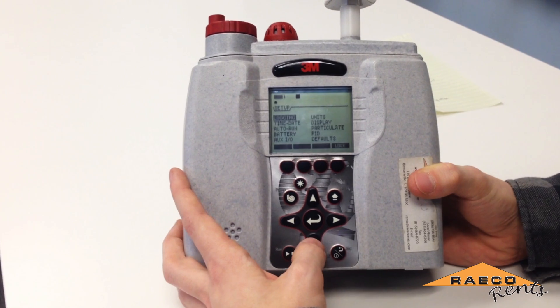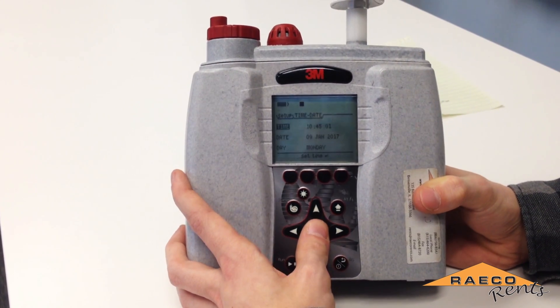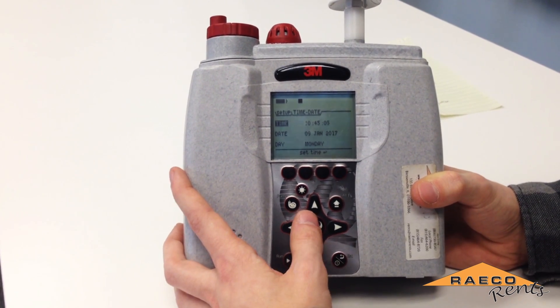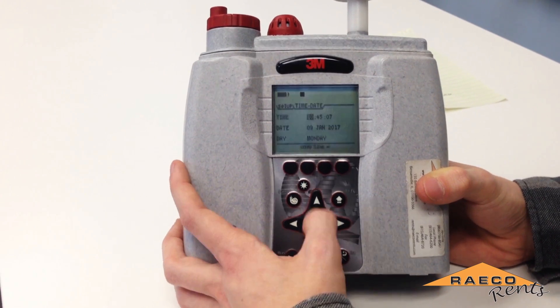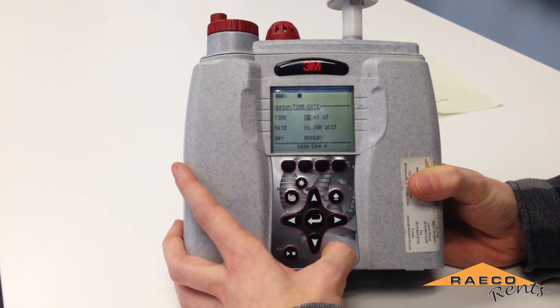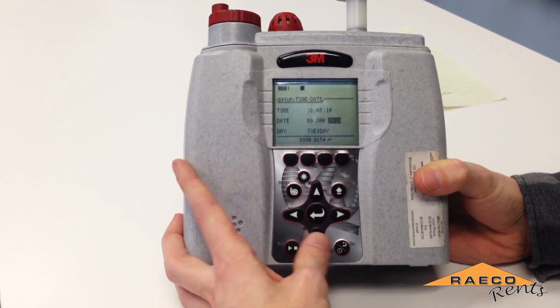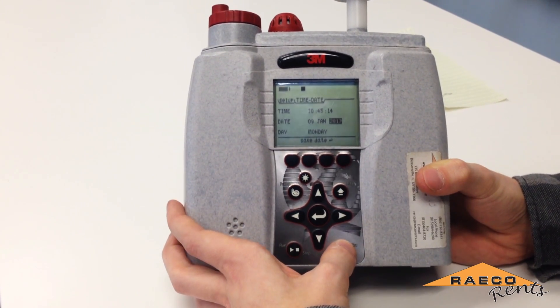Back out of the data logging setup, and make sure that the time and date are set up correctly so that your data logs have the correct timestamp on them. You can adjust the time by pressing the enter button and using the arrow buttons. Then go down to date and do the same there. The day of the week at the bottom should change on its own.